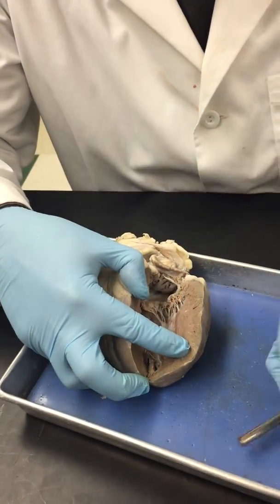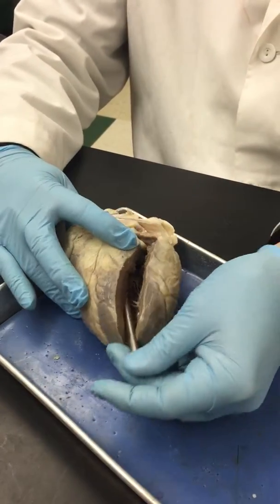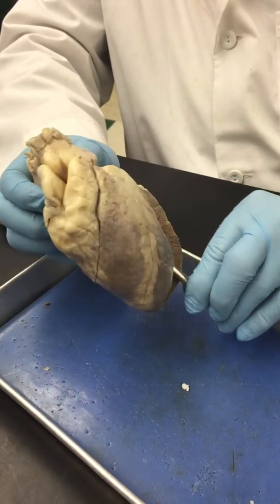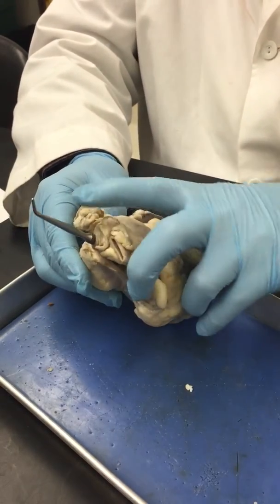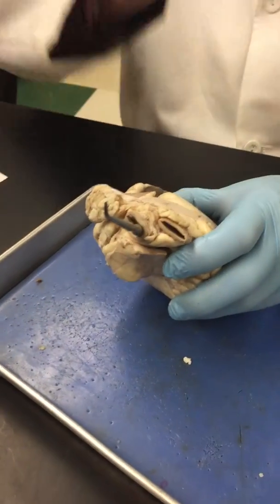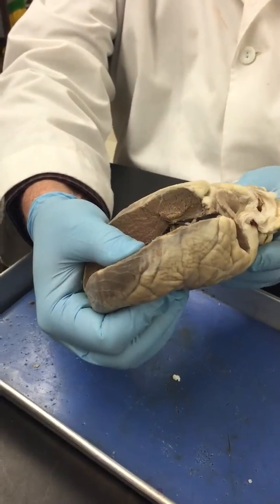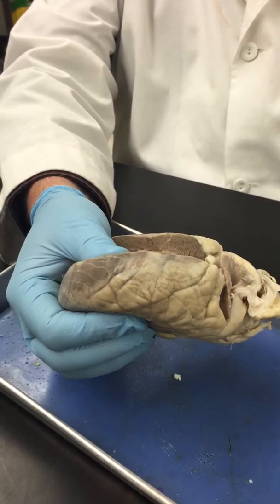Okay, if I put my probe up through here behind the mitral valve and go up this way, it'll emerge, I hope. Whoops. Let's do that again. There we go. My probe's now going out of the aorta. The aorta has an arch up here, which has extensions from it that will ultimately go to various parts of your body. But my probe right now is going through the aortic semilunar valve, which you cannot see unless we cut the heart completely in half. But that's the last valve you need to know.